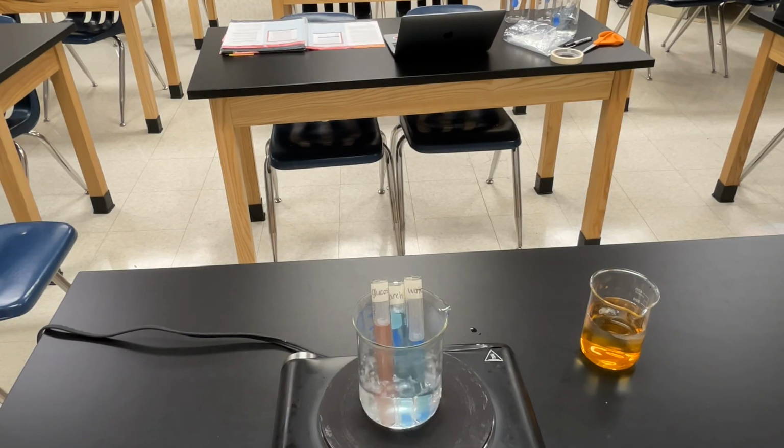We will let the dialysis tubing sit in the beaker with the iodine liquid mixture for 30 minutes or until we notice a change. Remember that the dialysis tubing is acting as a cell membrane. While you wait for results, make a prediction. Do you think there will be a change in color? If so, which molecules do you think will move and where will they go?